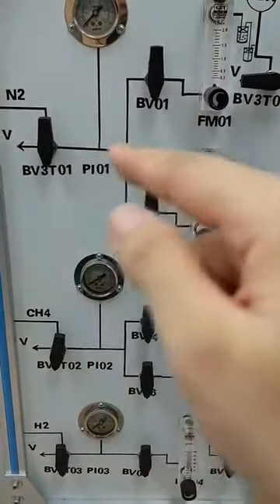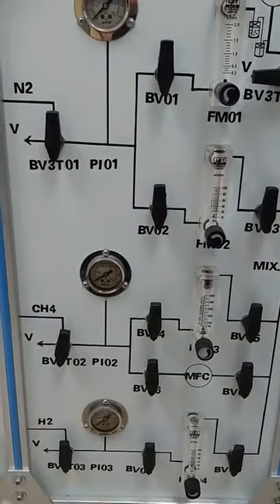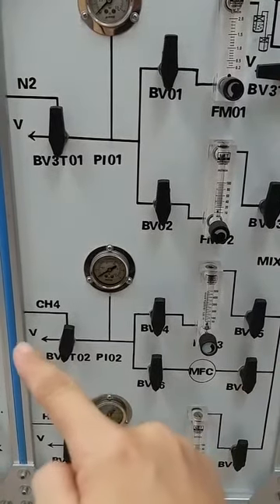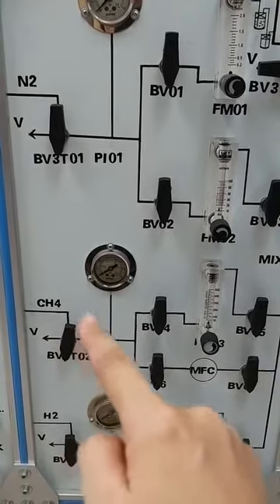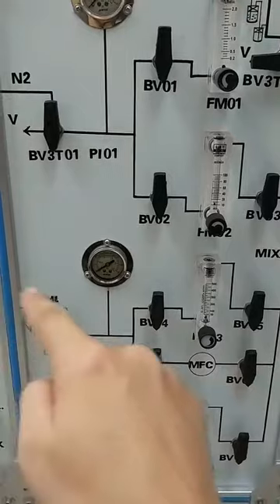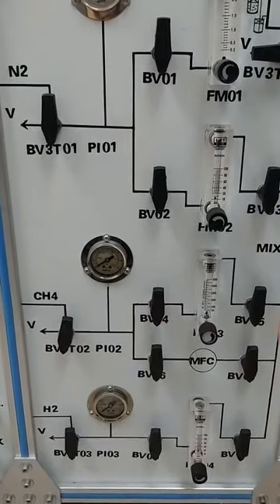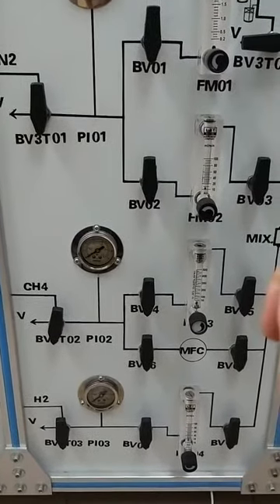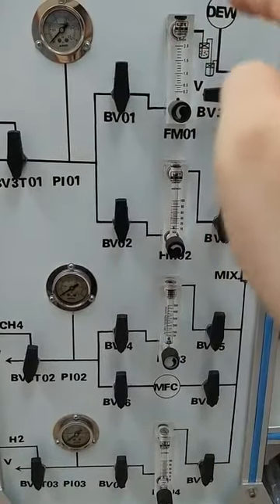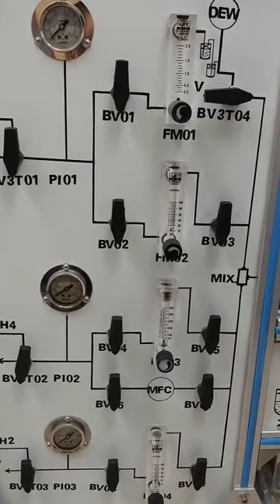After that, shut off the nitrogen and change to reduction gas if your catalyst needs to be reduced. Otherwise, you can directly inlet your reactant gas, through the MFC, or through the mass flow meter. If you have steam to be supplied, you can supply it through a steam saturator or a steam generator.